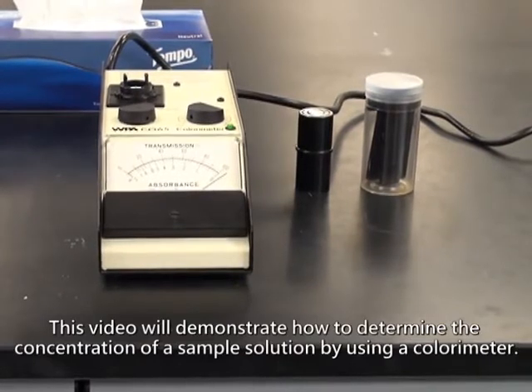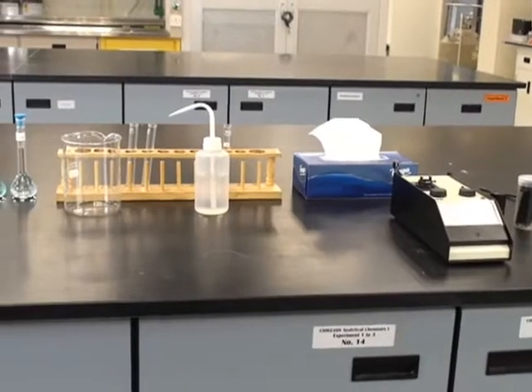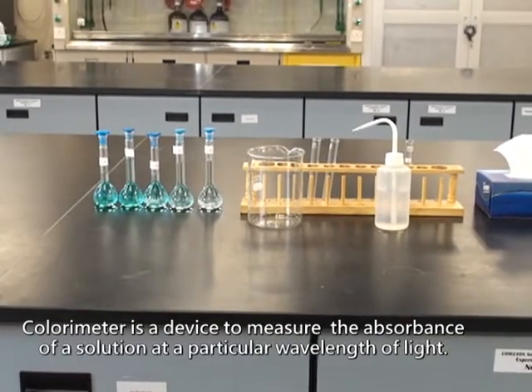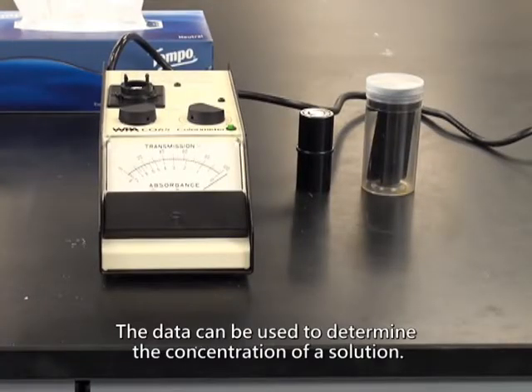This video will demonstrate how to determine the concentration of a sample solution by using a colorimeter. A colorimeter is a device to measure the absorbance of a solution at a particular wavelength of light. The data can be used to determine the concentration of a solution.